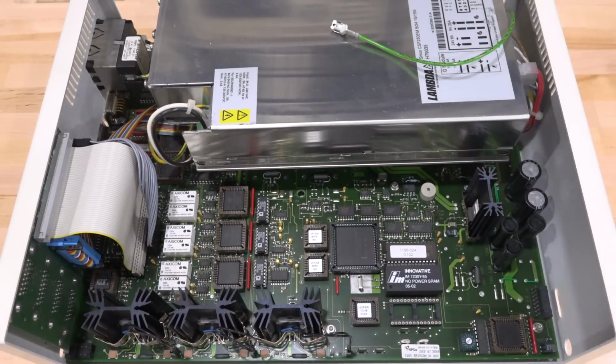And here's what's inside the MCU28. There's a lot of replicated circuit in here because every motor controller is independent. X, Y, Z are controlled with these three drivers over here, a lot of relays and a lot of independent samplers and processors and memory and so on built into this. Now, back when these things were built, the processing power was quite rare, so you couldn't do a lot of these things in software. So all of this has a combination of background software and background hardware that are running, freeing up the CAN interface for you to send a lot of commands. So you don't have to boggle up your software or different parts of the instrument, and you can control them all at the same time.